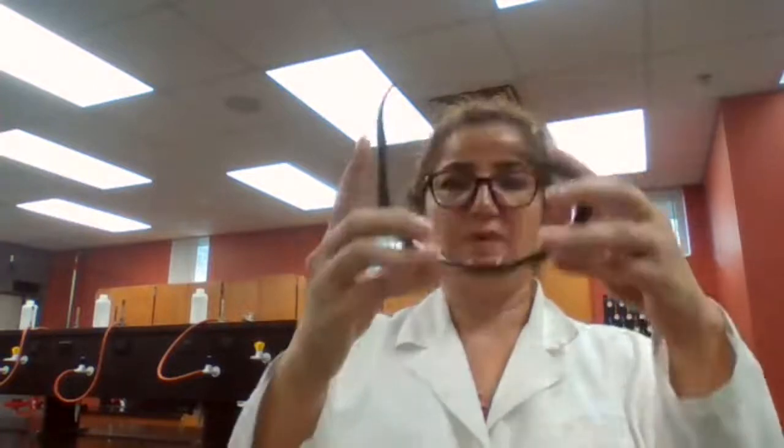And if the mass of the copper that we get is lower than the 0.4, then you have to explain why we got less than 100%. What are the possible ways that we actually lost the copper? I noticed when I was pouring out the solution, it was still blue. That means we didn't get all of the copper back. But it was very light blue, so it means that we lost very little mass of copper. Do you have any questions for me, now that we are done with the experiment?